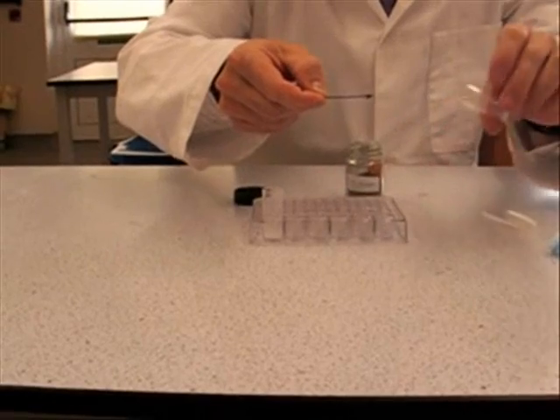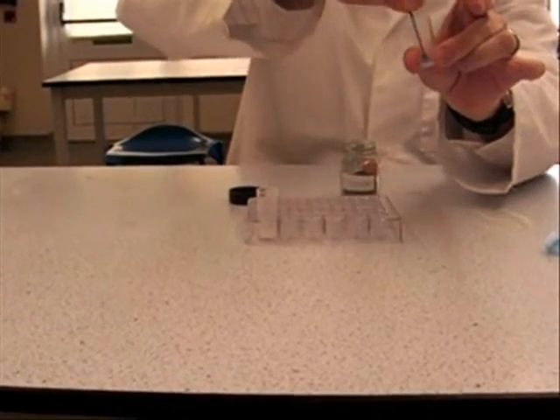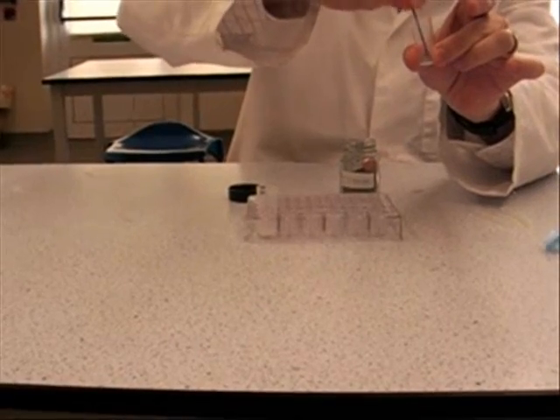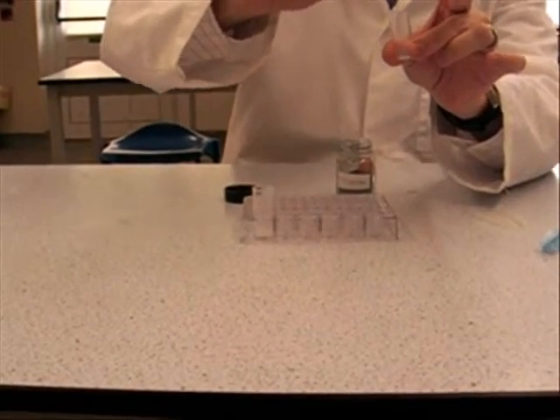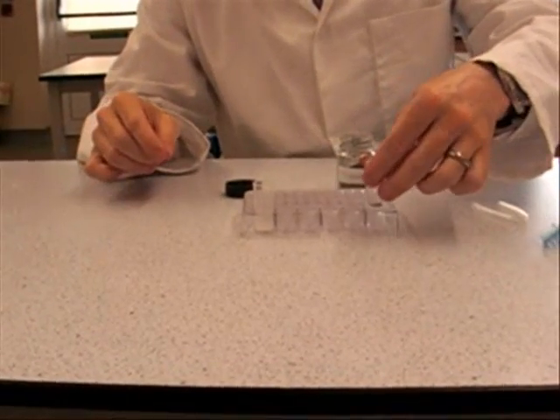So you've got a level spatula, it's a tiny amount. And just pop it into one of these ones. But it's probably better if you just tilt it so it reaches the bottom and then do that. Put that to one side and pop that in there.